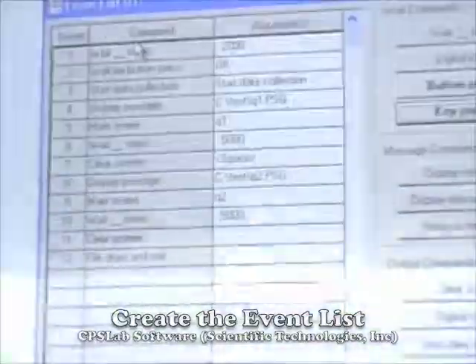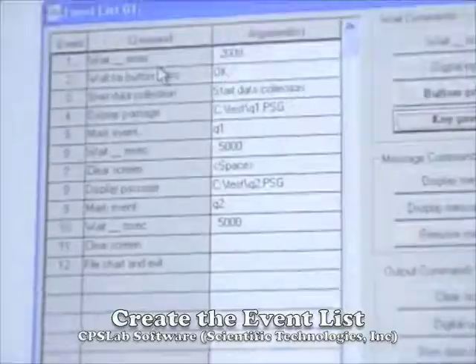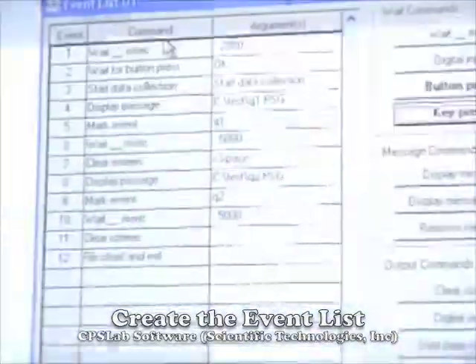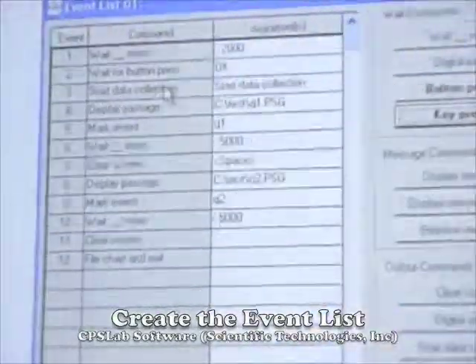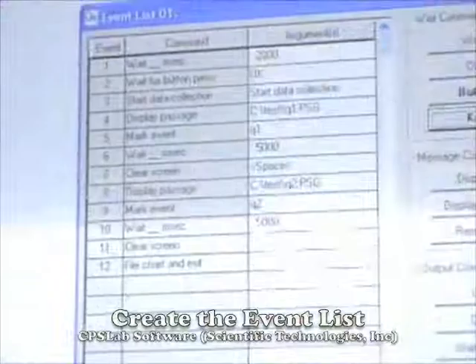Okay, so you can create as many event lists as you need. You can use the same one for every repetition if you want to do multiple repetitions, but usually we do between 3 and 5 repetitions depending on the context, and we can rearrange the questions within that event list so the subject doesn't see the exact same thing every time.